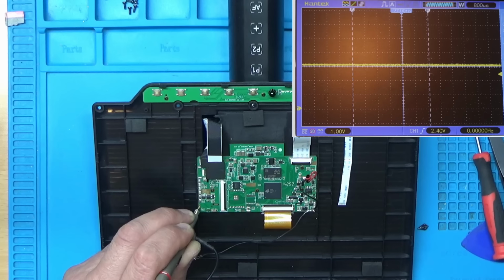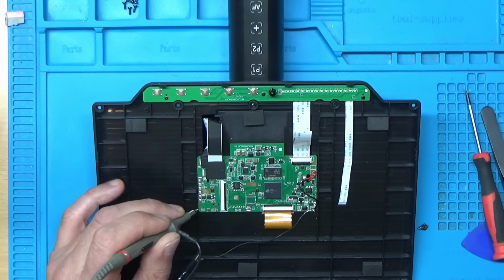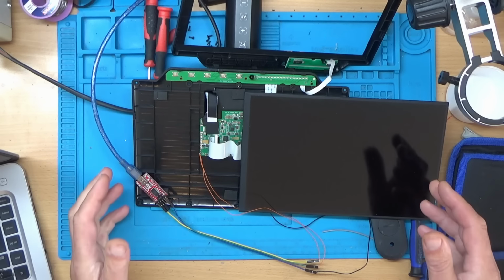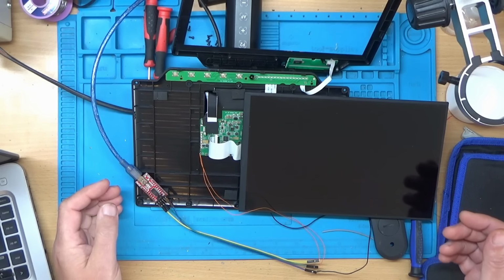That's it. You only get a brief flash at power on, and that's it. I mean, I could hook it up to the laptop. Well, I put the microscope all back together, but unfortunately I still didn't have any sound recording.